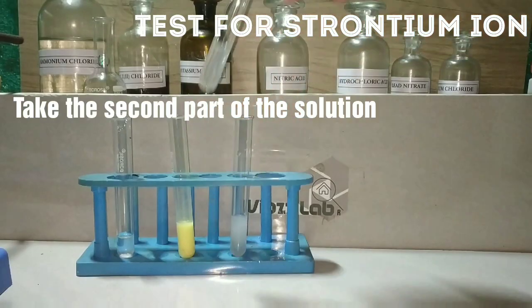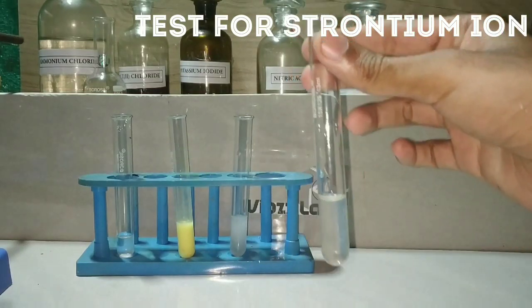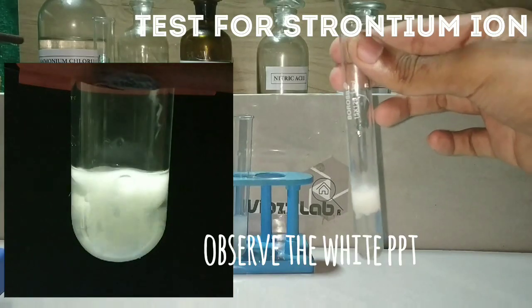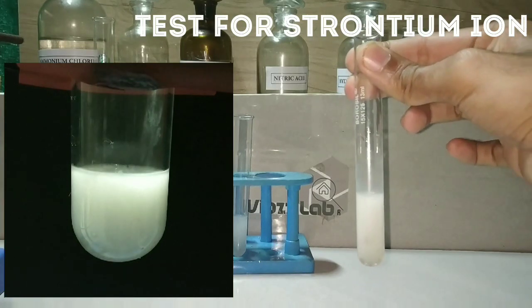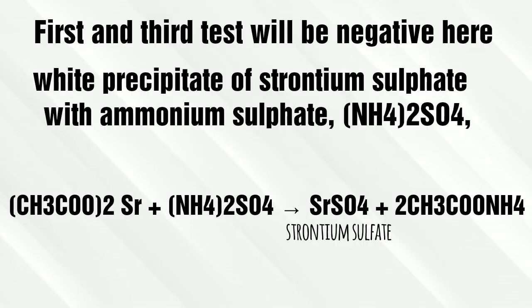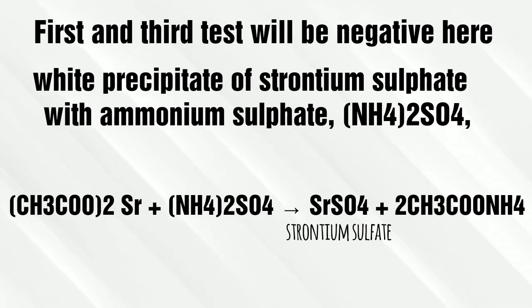In the second test tube, we test for strontium ions. All Group 5 cations should be treated with ammonium carbonate, the precipitate dissolved in acetic acid, and divided into three separate test tubes. For this video, I have taken the second solution as strontium and added ammonium sulfate, resulting in a white precipitate of strontium sulfate. Strontium ions give a negative result in the first and third test tubes.